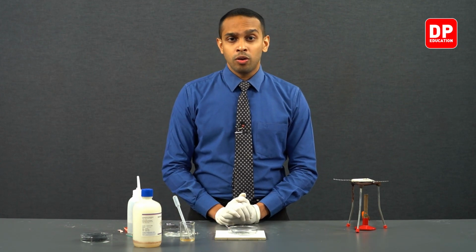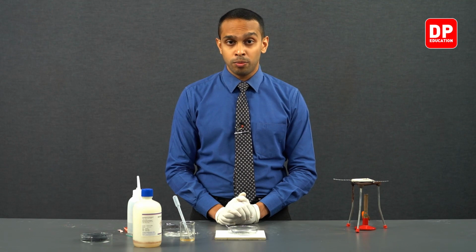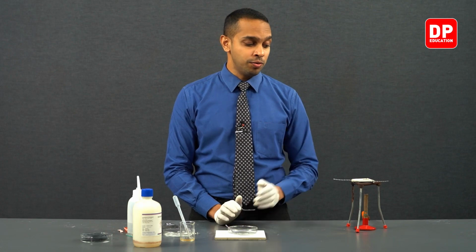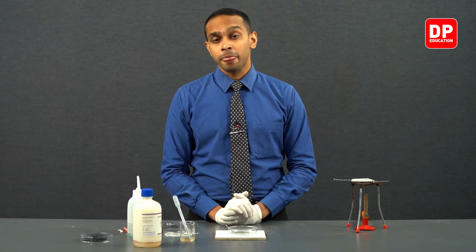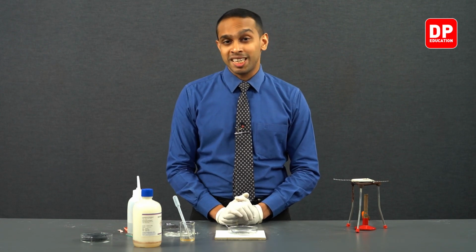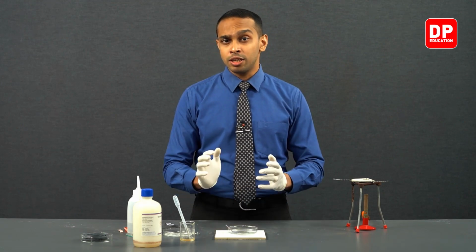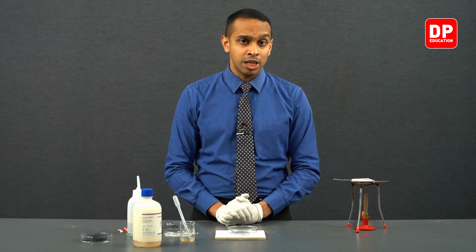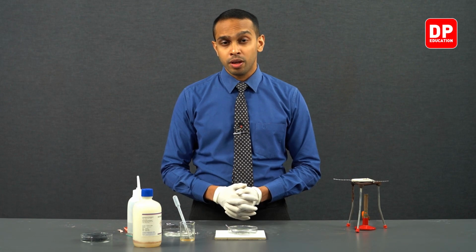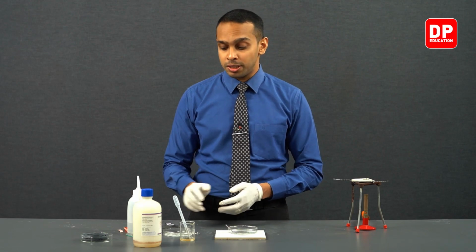As a summary, we observed that magnesium, when it is burned in air with enough and more oxygen, will form magnesium oxide and a little bit of magnesium nitride. However, when you heat it inside a crucible, magnesium oxide along with a substantial amount of magnesium nitride will be formed. And when magnesium nitride comes into contact with water, it will form ammonia. Presence of ammonia can be observed with the use of Nessler reagent.